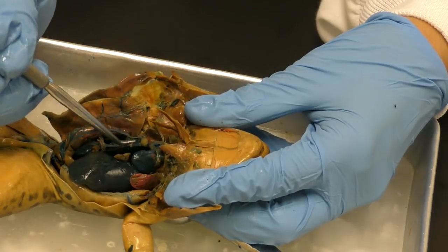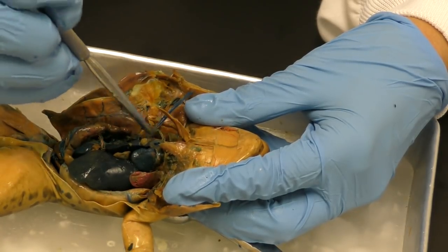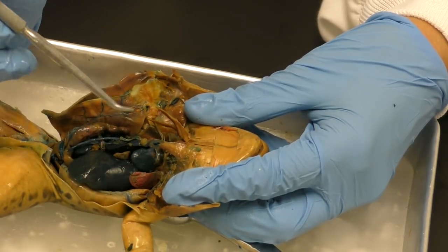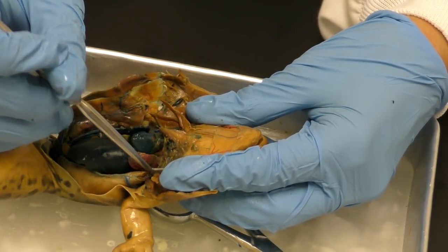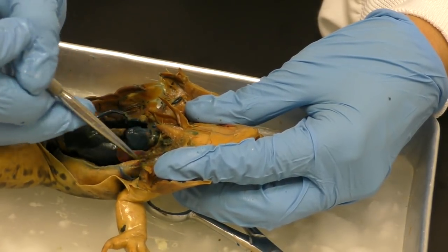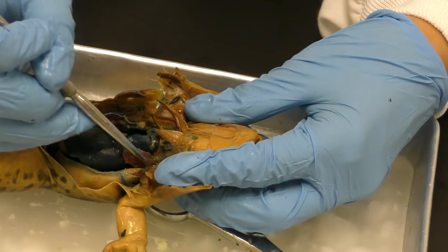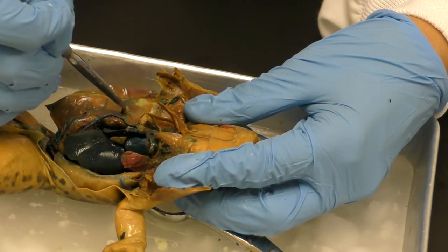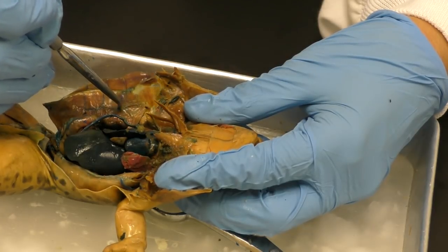So these vessels that are supposedly delivering deoxygenated blood are just for teaching purposes. Our blood is all the same color, and so is your frog. And frog blood is generally like a muddy clear color, much similar to its guts.